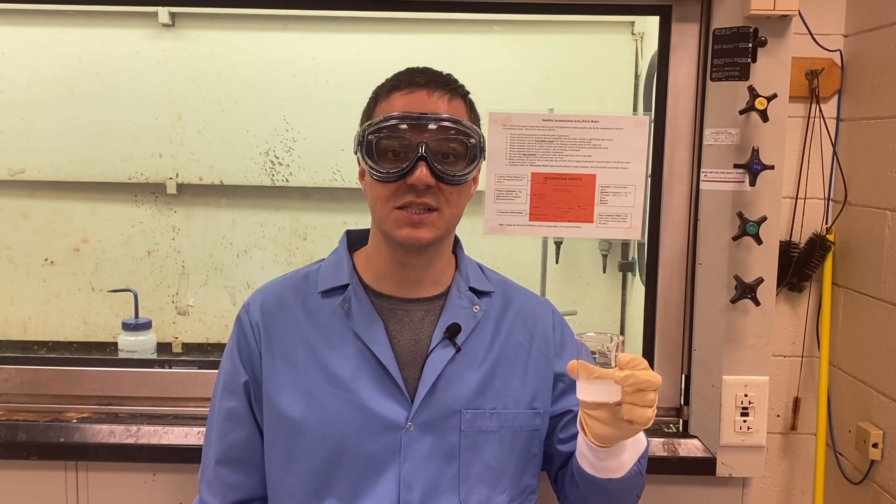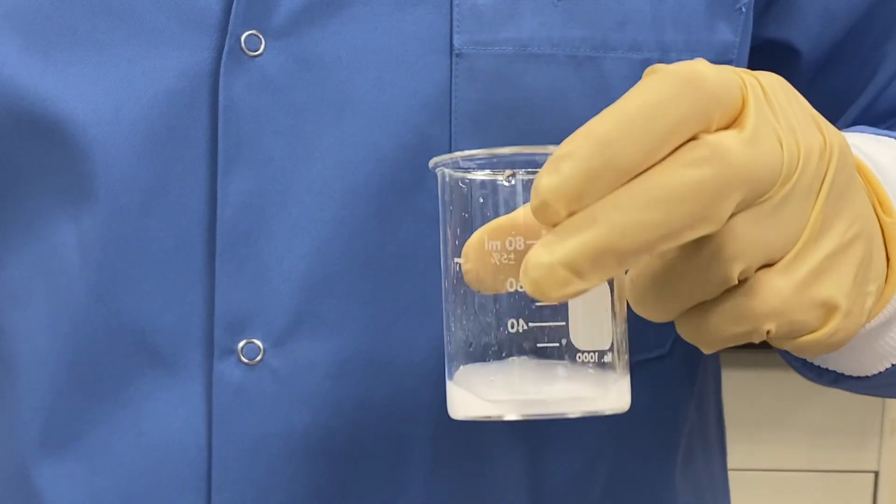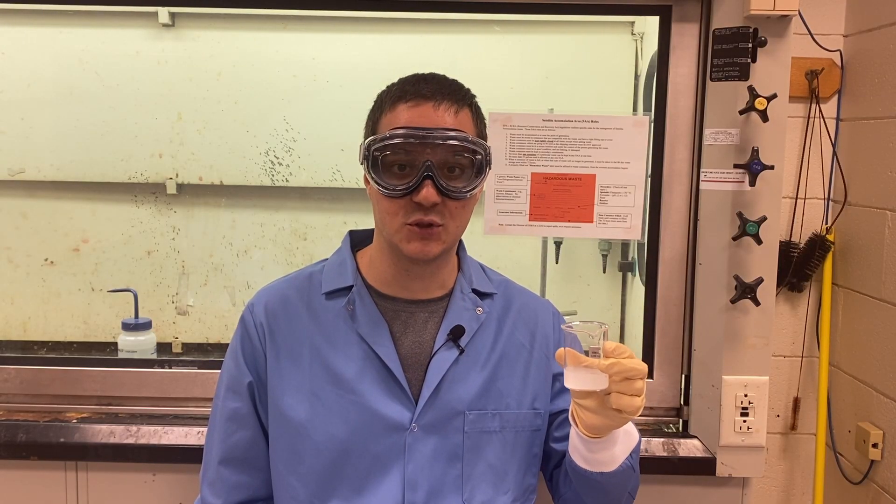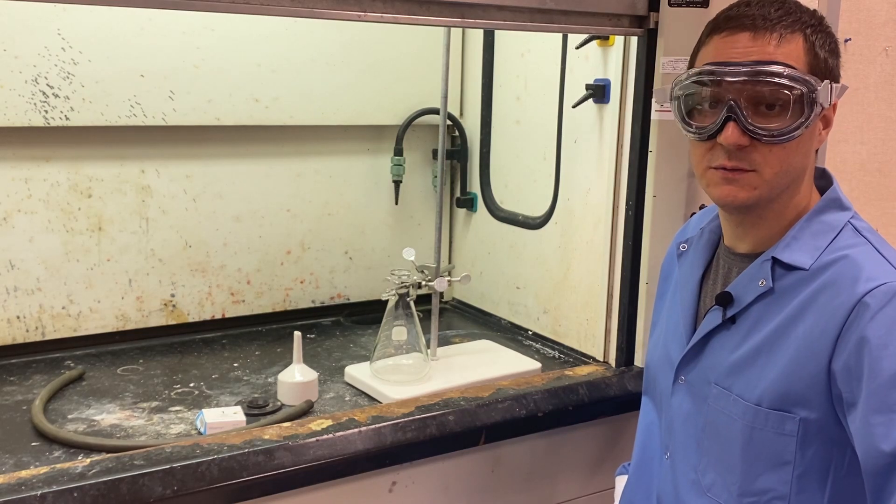Once you've precipitated your target solid, it must be separated from the liquid. The best way to do this is vacuum filtration. This is a vacuum filtration setup.